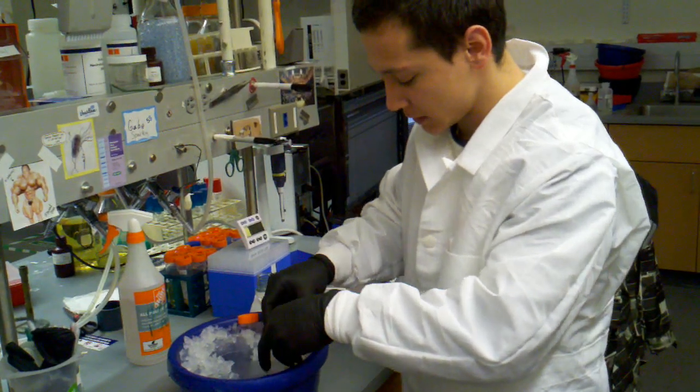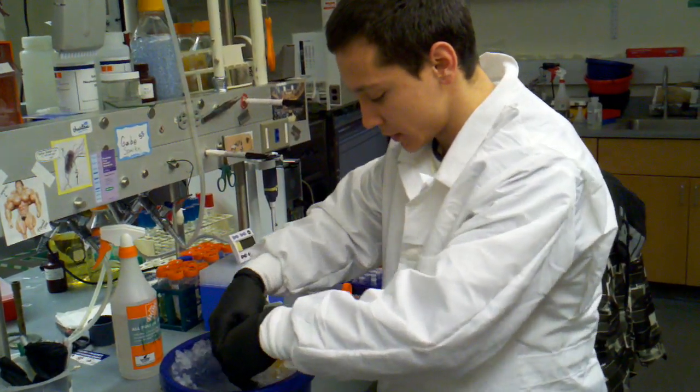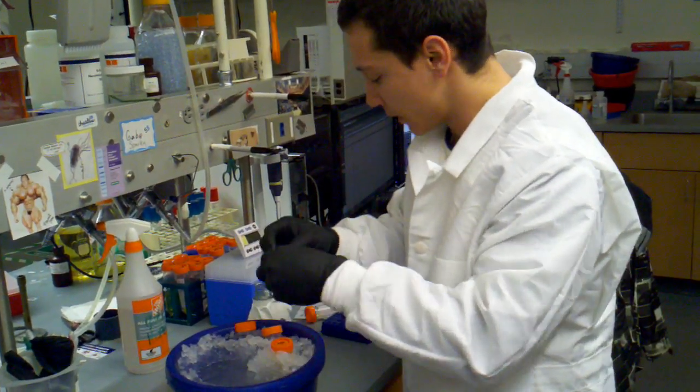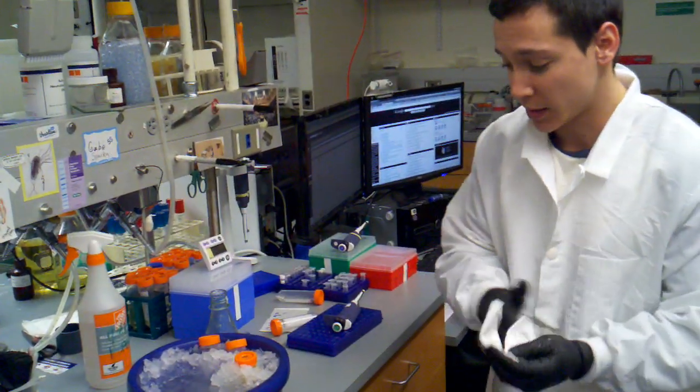And just make sure that this gets nice and cold. That's a really important part about this. Whenever you're doing any sort of transformation you want your cells to be as cold as possible.